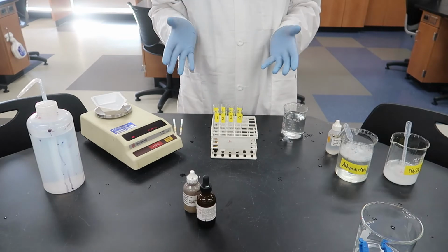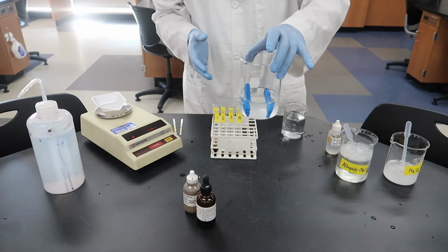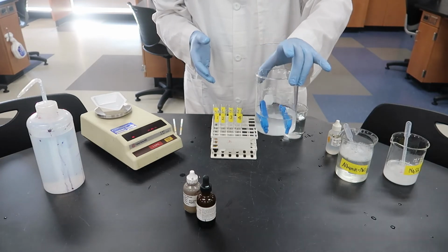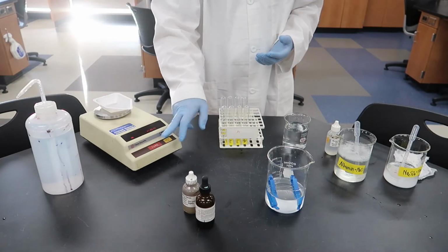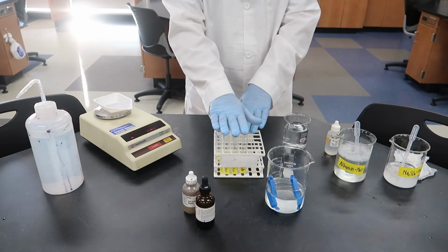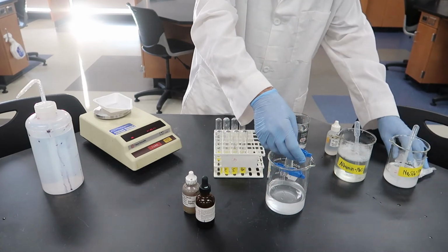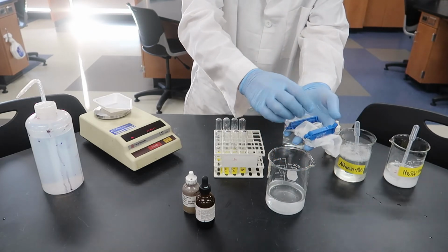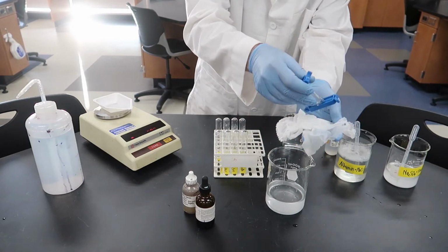Okay, we're ready to let our dialysis tubing sit for a while, and we're going to come back and see if any of these results change after this has had a chance to sit. Okay, so it has been about 45 minutes. I've washed the test tubes, and they're ready to go. You can see that the dialysis tubing has just been sitting in the beaker for about 45 minutes now. Before we do anything else, we want to weigh it. Again, if the mass goes up, that means water diffused into the bag, and if the mass goes down, water has diffused out of the bag by osmosis.